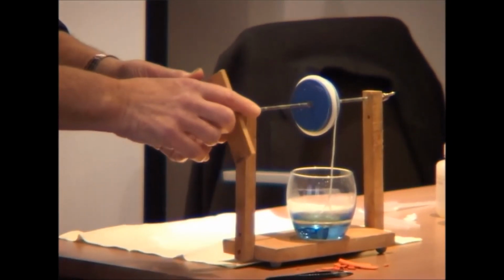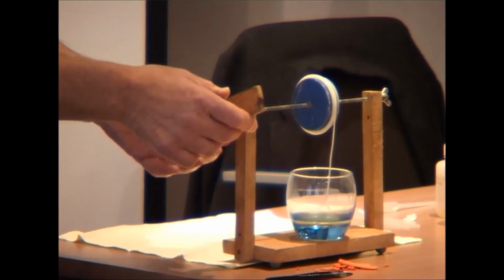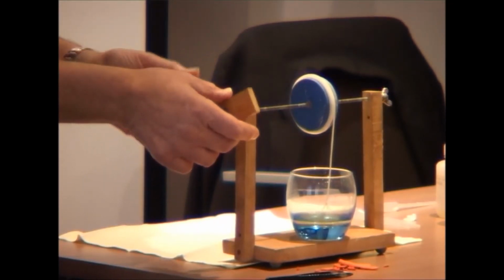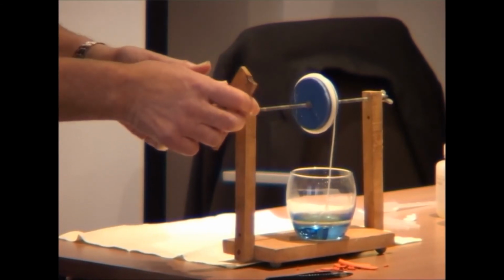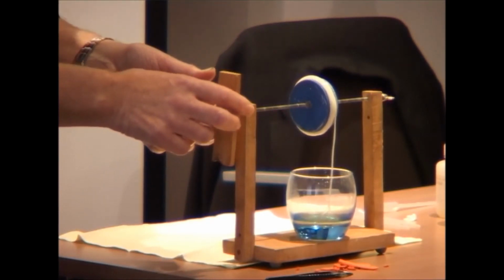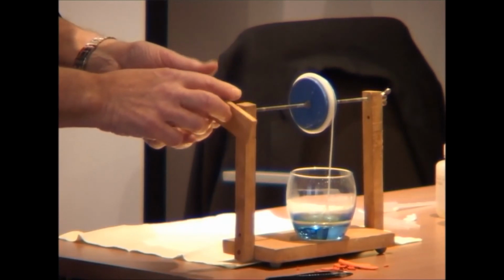Now, I don't want you to think this is one great long molecule I'm pulling out of here, because it isn't. There's many thousands of millions of molecules being pulled out of here. But they're all sticking together to form this sort of coherent fibre from this nylon. It's going to be nylon 610 actually. It looks fairly flexible, doesn't it? But that's because it's swollen with hexane.